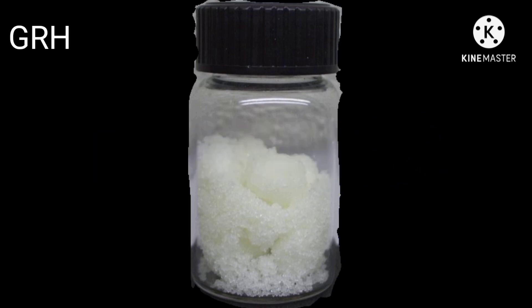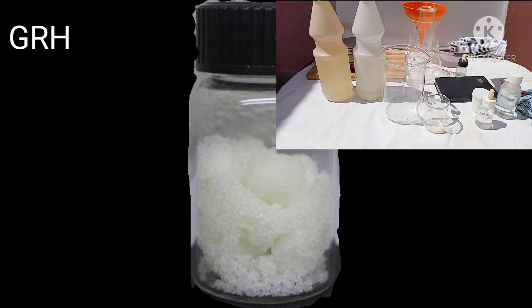Sodium nitrite has a limited shelf life and will lose its strength on long standing. However, if used to precipitate gold, it will not contaminate the gold when melting, even if it is not washed completely out of the gold powder. It is also inexpensive and simple to use. The gold solution is worked down and diluted as usual.